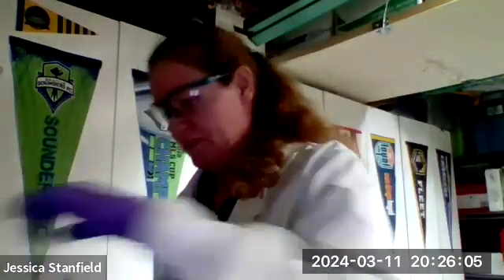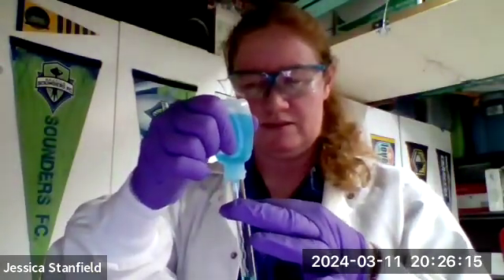Okay, another cool one is what we call a single replacement reaction. I'm going to take some copper(II) chloride and put it in this test tube. Now, on the activity series, aluminum is more active than copper, which means aluminum wants to be an ion more than copper does. So if I put some aluminum foil in this test tube of copper(II) chloride, the aluminum will start to react and dissolve into solution, and the copper will start to precipitate out as a solid.